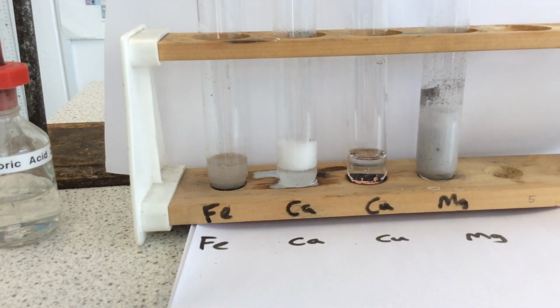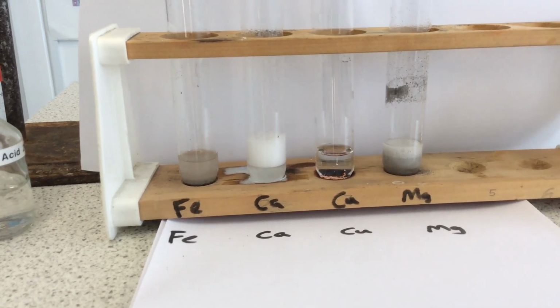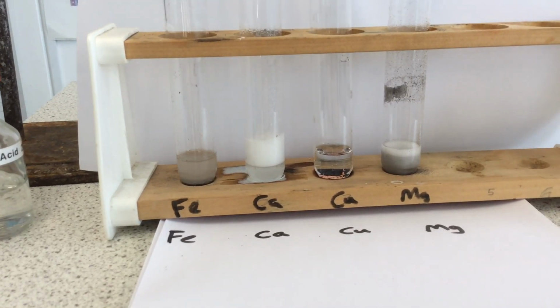Right, finally then, magnesium. And it would appear to almost be more reactive than calcium. That I think is a little bit more about how I put it in, and unfortunately this experiment is not quite fair because the calcium is not in a powder whereas the magnesium is. So please bear that in mind. However, after the initial reaction you can see that calcium is still frothing away compared to the magnesium. That initial reaction was more due to the fact that the magnesium is powder form and not granular form.